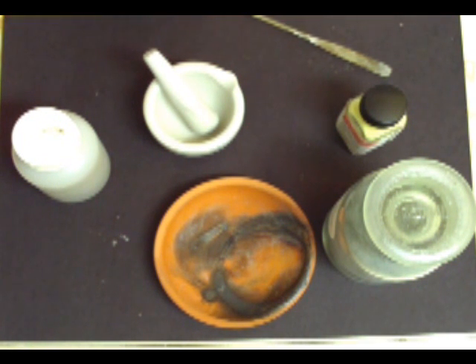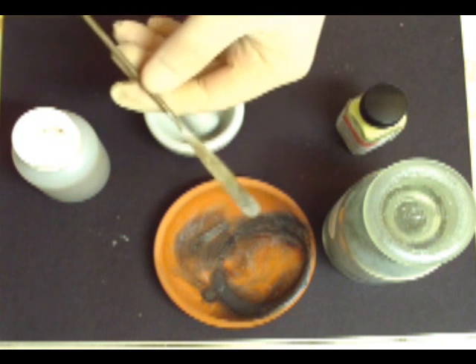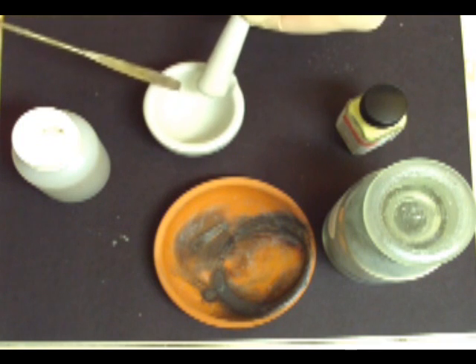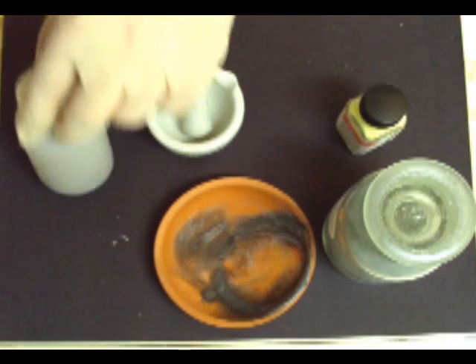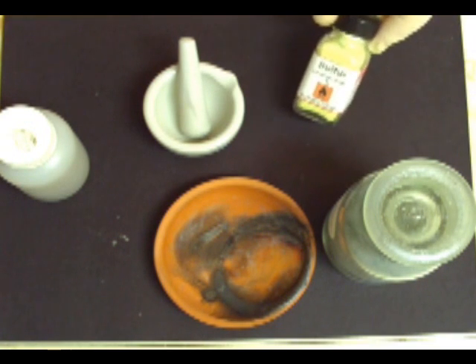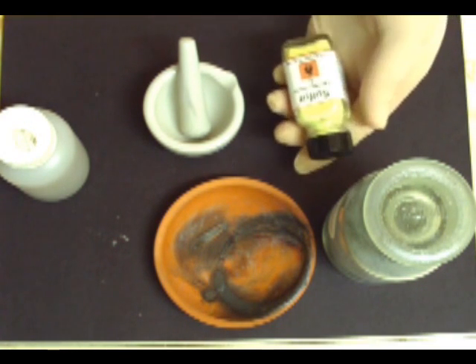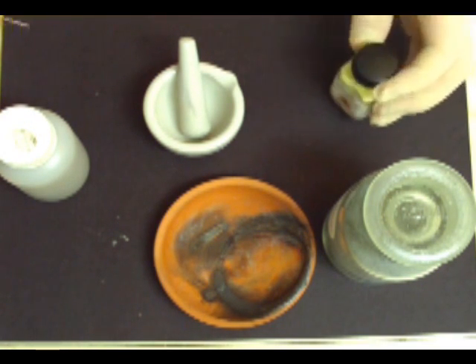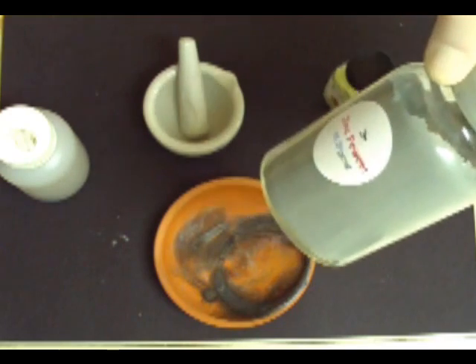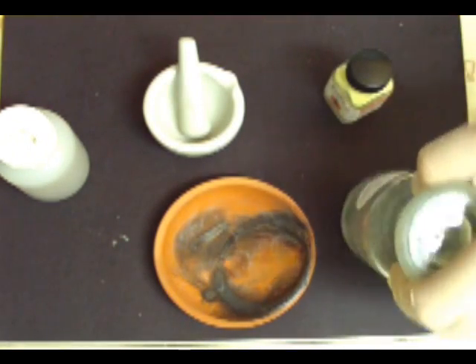To begin with, you're going to need the following: a spatula, a mortar and pestle, some copper dust — this is optional — sulfur powder, and some zinc powder. You're also going to need a heat-resistant plate; in this case I use the bottom of a clay pot.